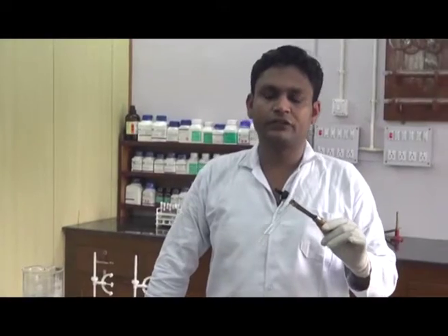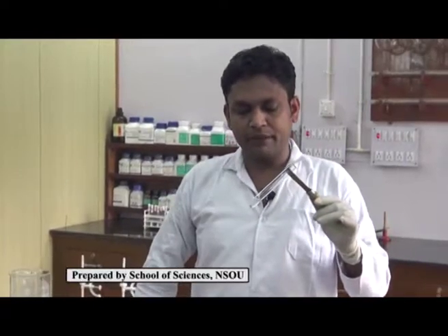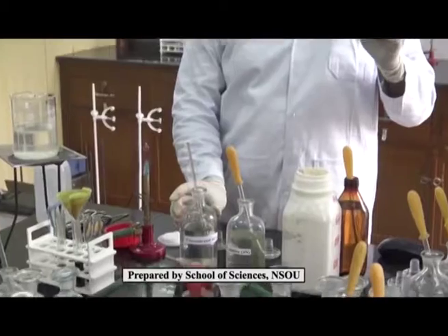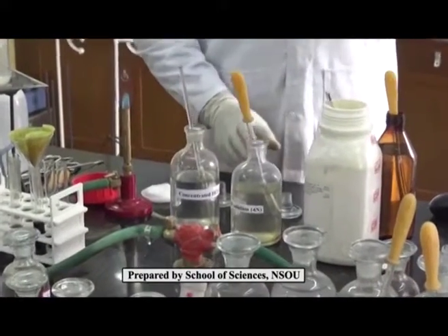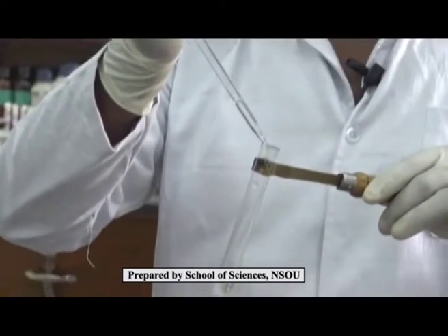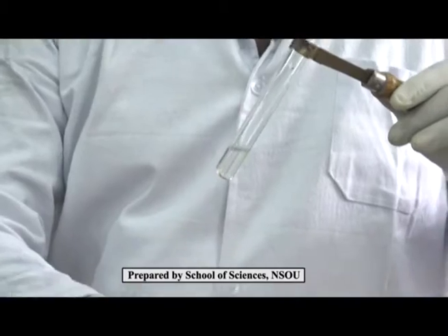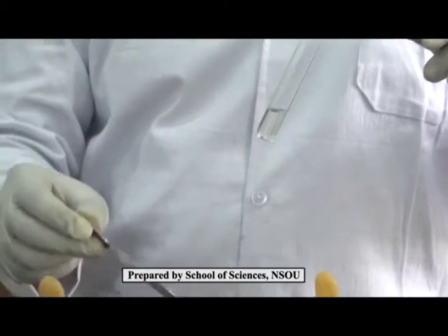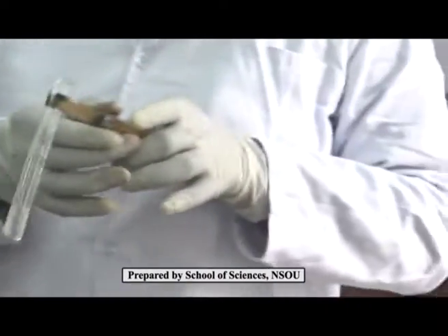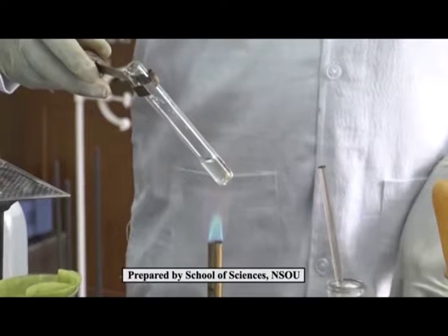Now we will test for the amide group. For this test we need the sample, NaOH solution, and a glass rod dipped in concentrated HCl. At first we take NaOH solution in a test tube. Then add the sample into the NaOH and heat it over the Bunsen burner.